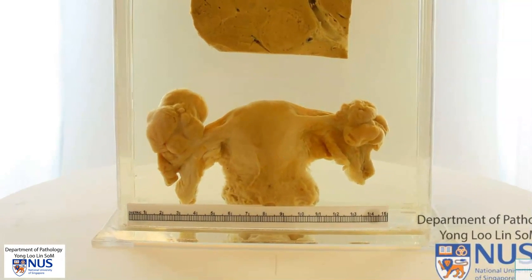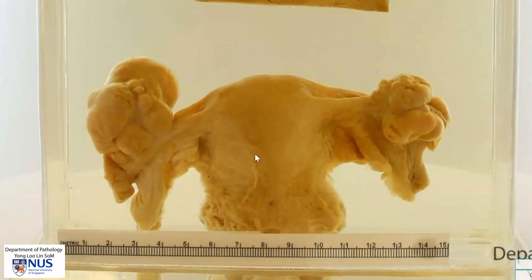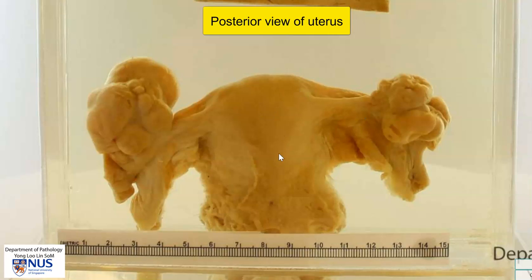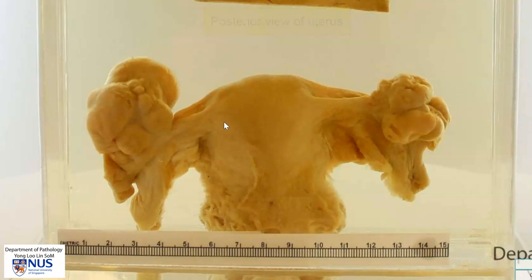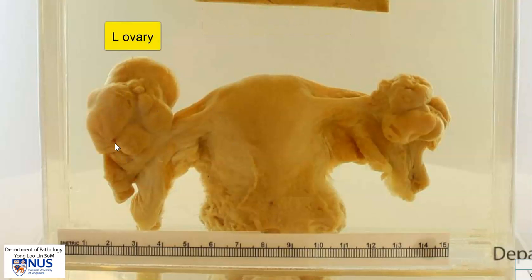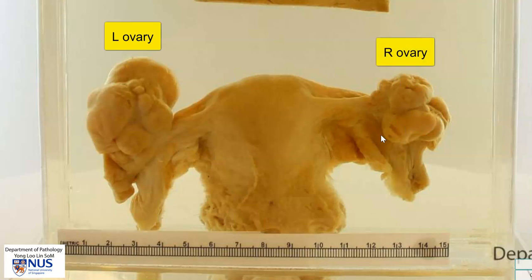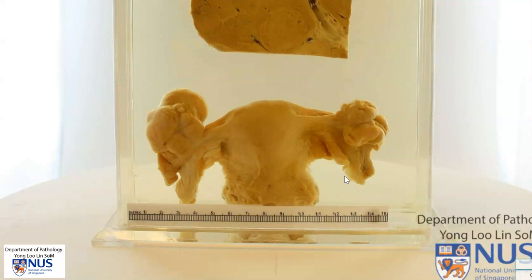And now moving down to the uterus, what we're looking at here is actually the posterior surface of the uterus. This is the uterine serosa, which is relatively smooth posteriorly. This is the left ovary, which is enlarged. And this is the right ovary, which is also slightly enlarged. So we have a uterus with bilateral enlarged ovaries.